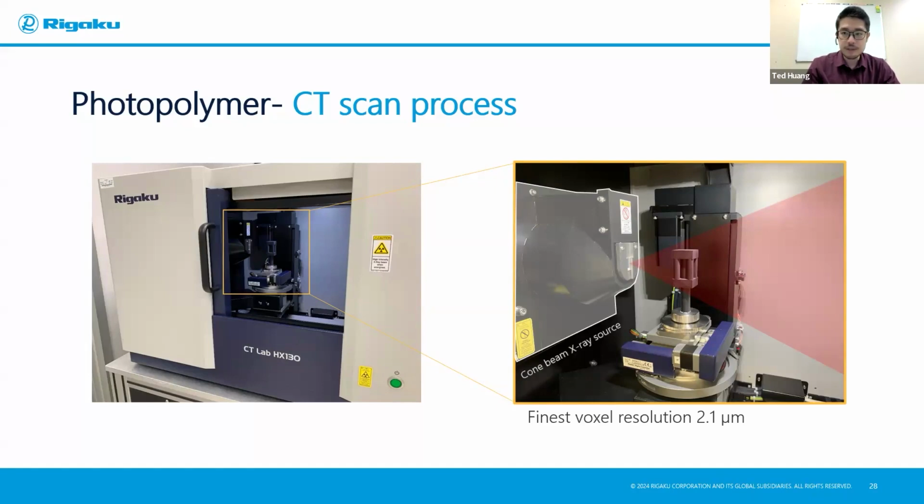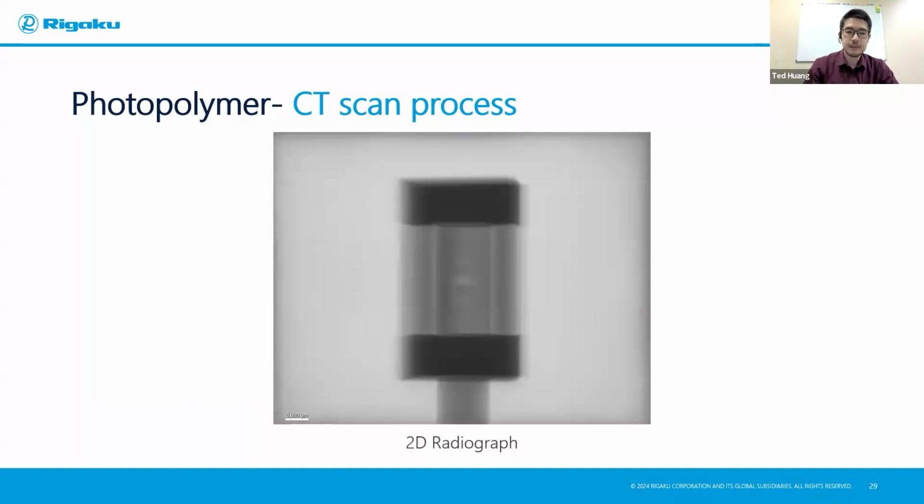When you turn on the X-ray, what the detector sees is like this. If you just stop there, that's just a 2D radiograph. But granted, even with this, you're getting something already. You're seeing there seems to be something happening at the center pillar. There's maybe a gap, a void, but we don't have to guess. We can do a full 3D scan of it and then find out what is happening inside.